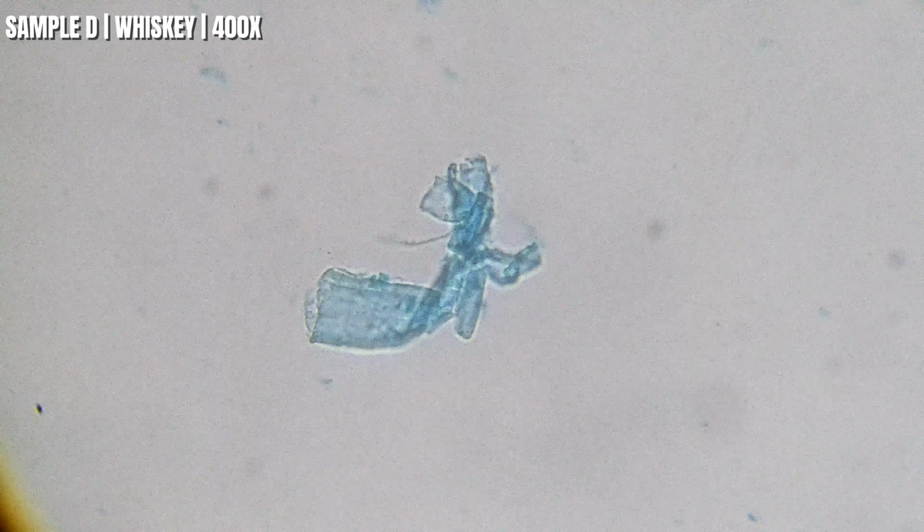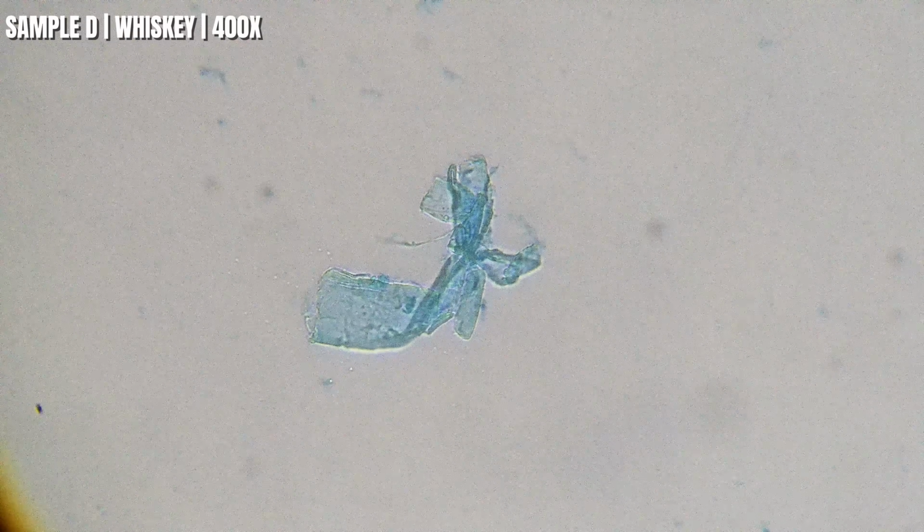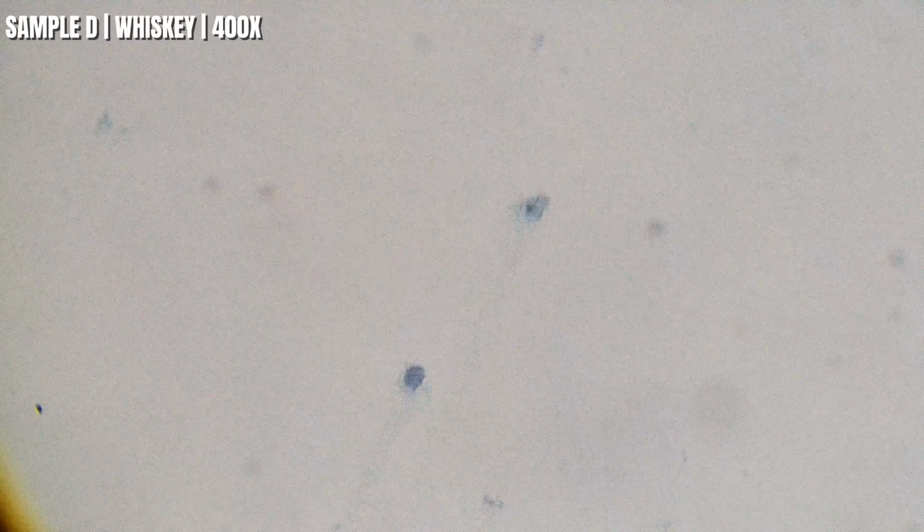So we're up 400 times now, and this one's pretty clean slate. Even at higher magnification, the sample looks clean. There are a few tiny stain particles here and there, but compared to some of the other whiskeys, I'm just not seeing much suspended material. And that's exactly why I like comparing samples side by side. So finally, let's get to the nematodes and see how they fare with these 4 whiskeys. You guys ready for this?